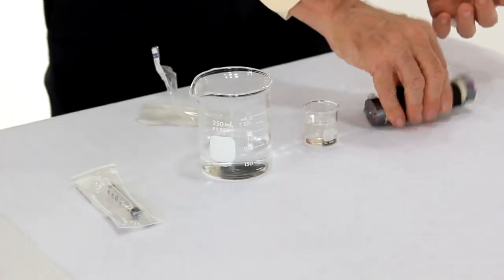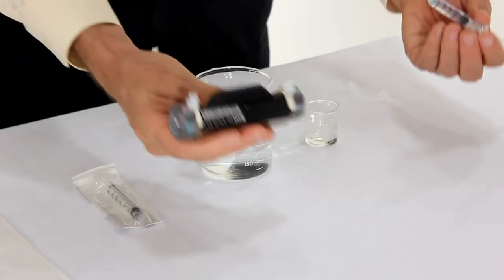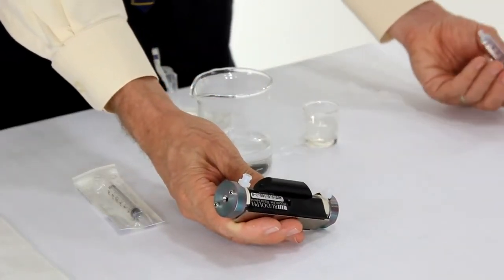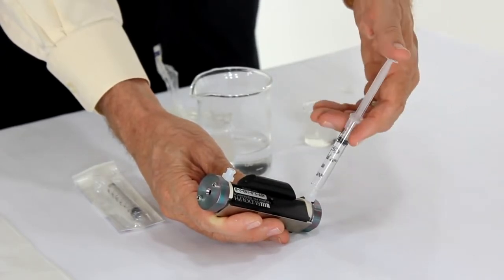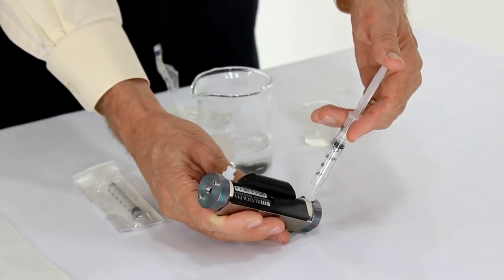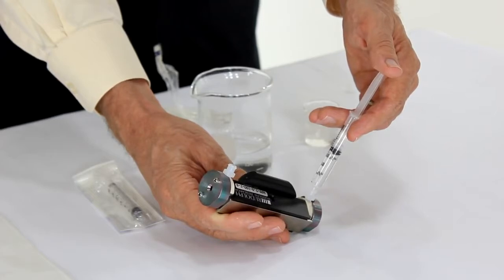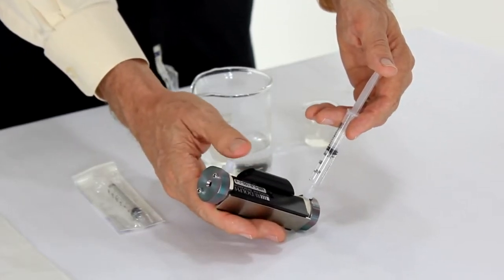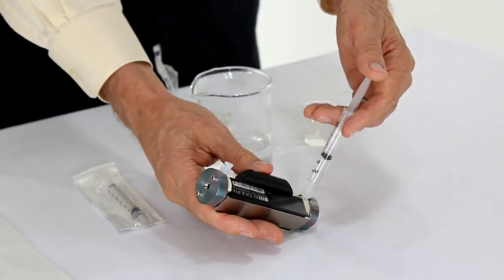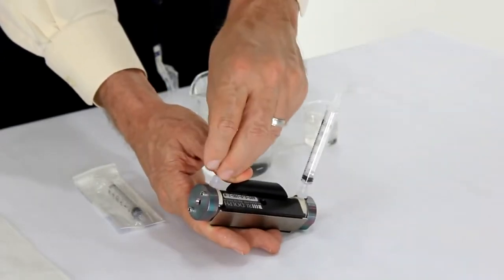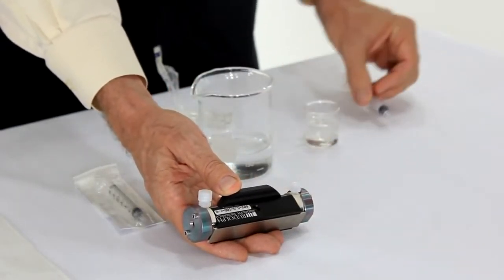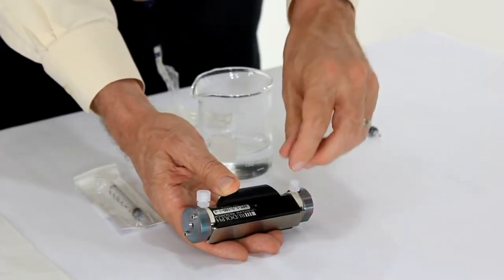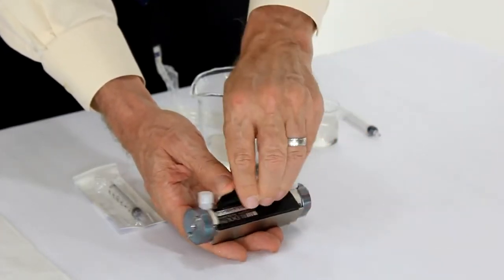I hold the cell in one hand, the syringe in the other hand. I make sure the top of the cell is pointing towards the ceiling and I place that inside there. I will now slowly inject the sample into the cell while looking at the end, and when I see the sample appear at the other end I will place a cap on the cell, place a cap on the other end of the cell and now we're ready for measurement.